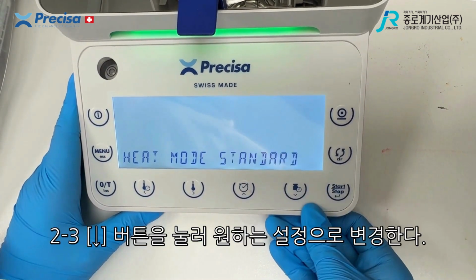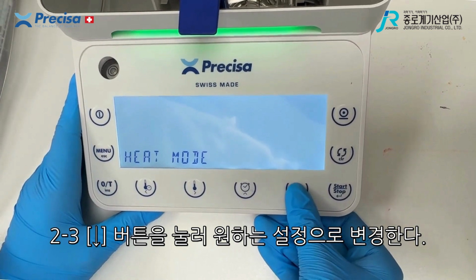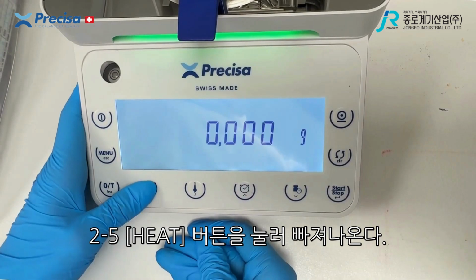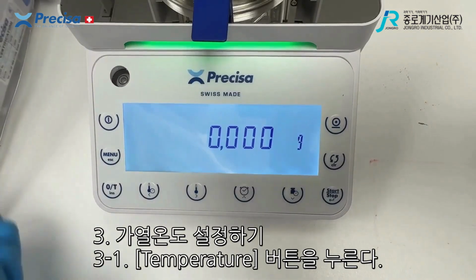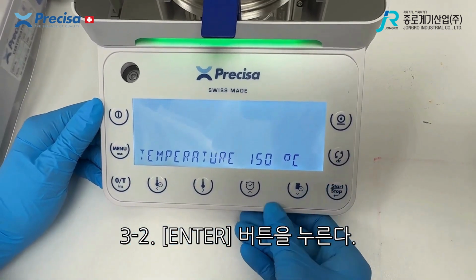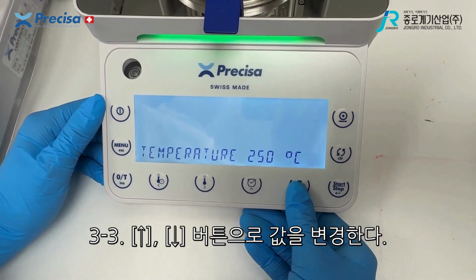You press this button here in order to go onto the different heat modes. Press start, and then you're able to scroll down until you find the heat mode that you require. Press enter to select it, and then go back to the menu. To change your temperature, press this button here. Press start, and then you can scroll through the different number options.